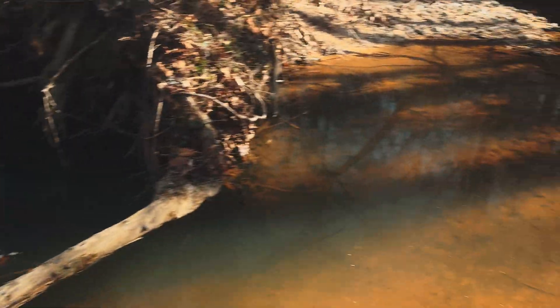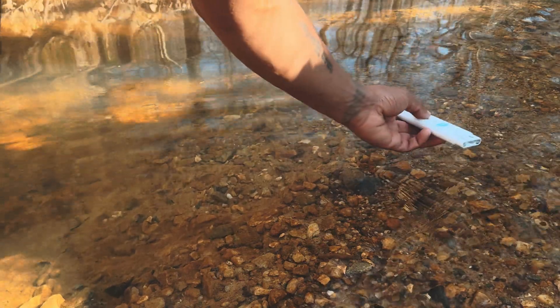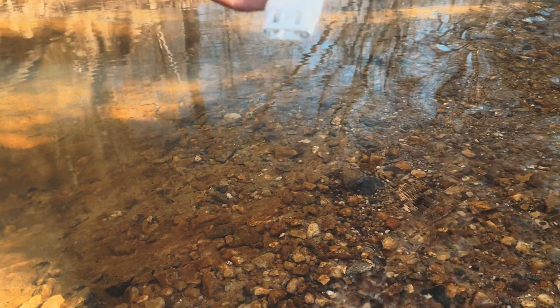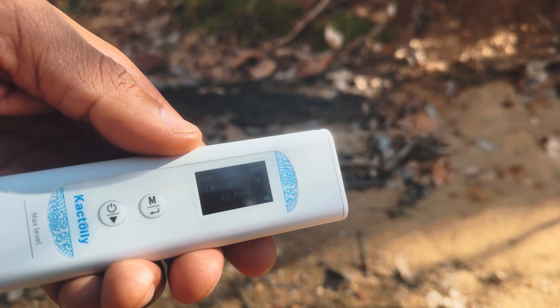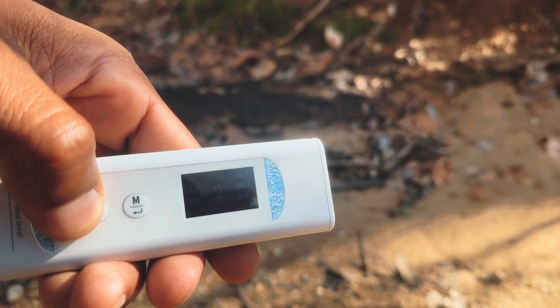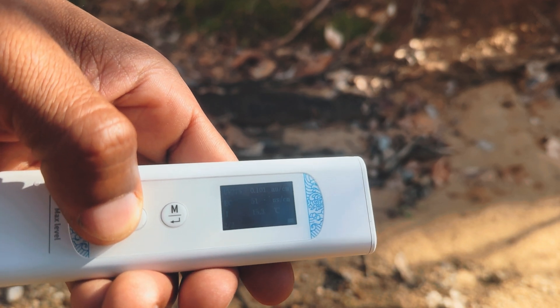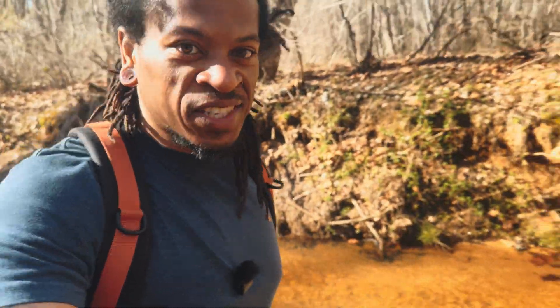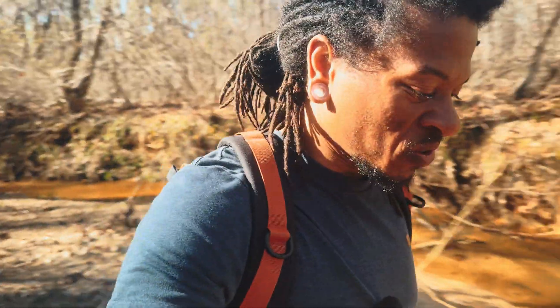It makes me want to try over this side to see if it's any difference. Let's do it — past the minimum so that should be good. 43 — so that's a little better over this side, still poor. The screen is red — the camera's not picking it up, but it's red and it says 42 poor. And then if you hit that button it shows you a whole bunch of other things in this water, like 15.3 Celsius. This is really fun actually. This may be a new thing on the channel — just going around and testing water. It's a beautiful creek nonetheless.